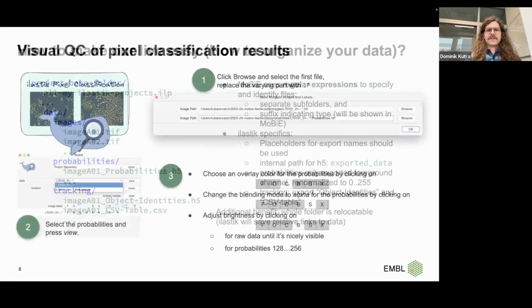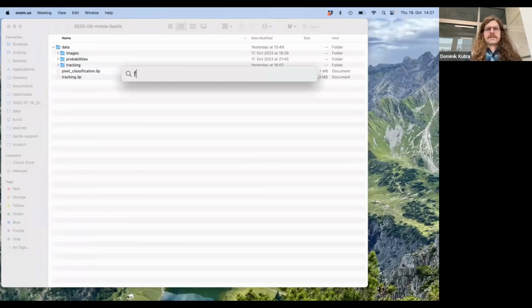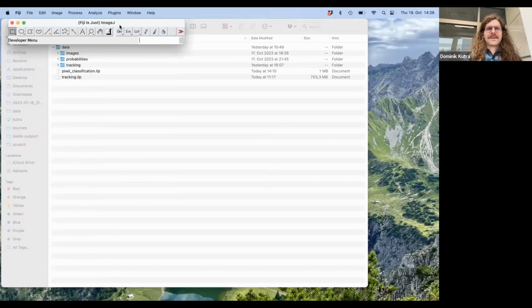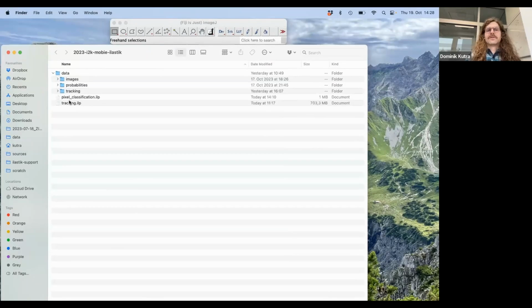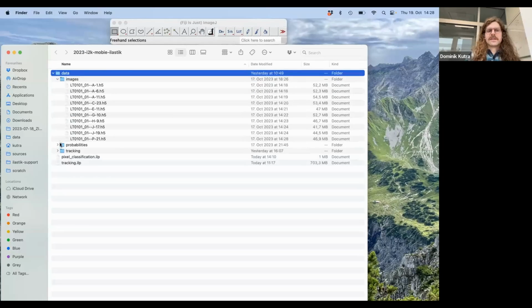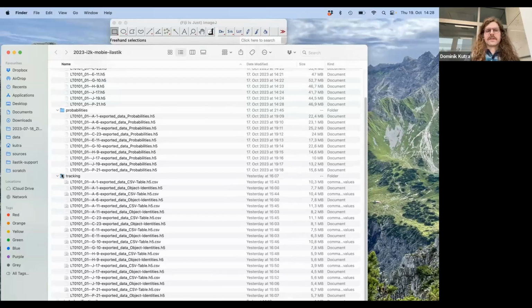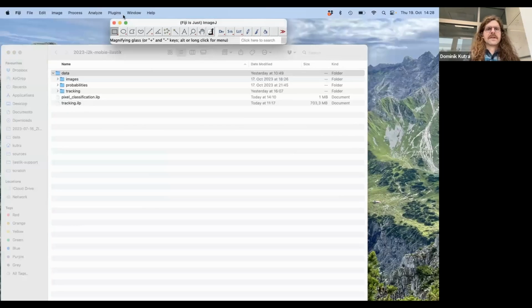Okay, so let's do our first task, which would be the pixel classification inspection. First we have to start Fiji, and do not do an update. In the meantime, I can show you my folder, and how I organized it. There is this data folder, and in it I have images with the raw data, probabilities with the results of pixel classification, and tracking with all the results from tracking that I want to show you. And here in the top level I have the Ilastik project files that were used.